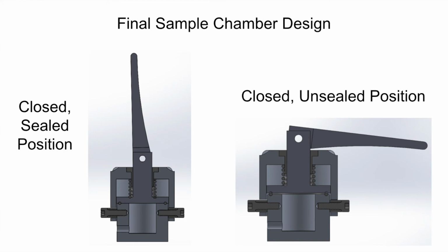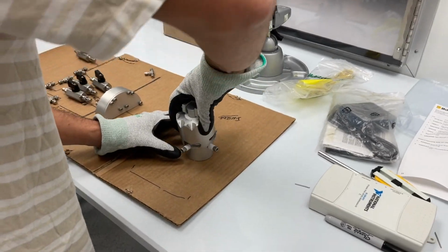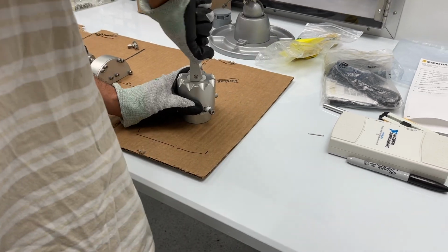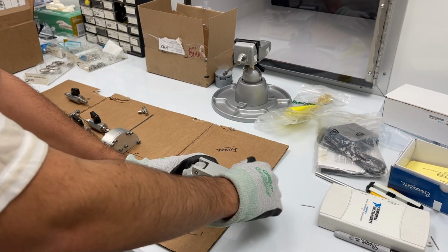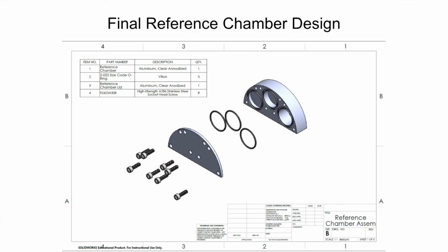It still used a spring-driven piston to seal the apparatus, but a cam lever was added to the piston for a number of reasons. With a cam lever, an adequately strong spring could be used in order to fully compress the O-ring. It also allows clearance for the O-ring while the lid is being installed, eliminating all shearing on the O-ring. The reference chamber is a much more simple design.